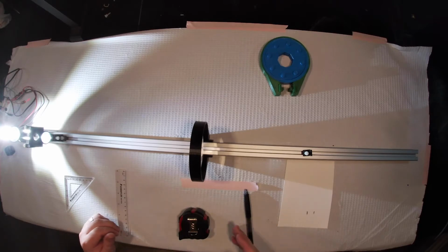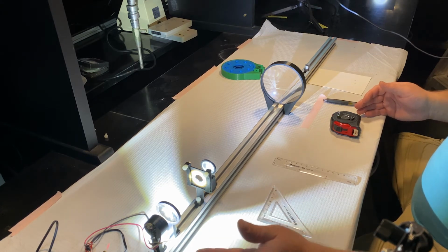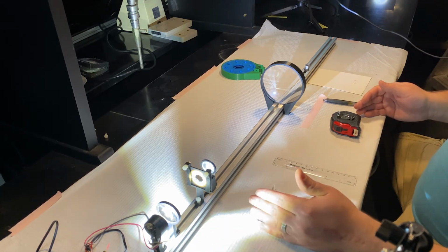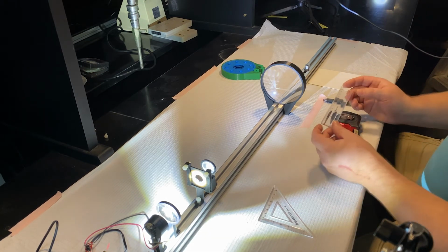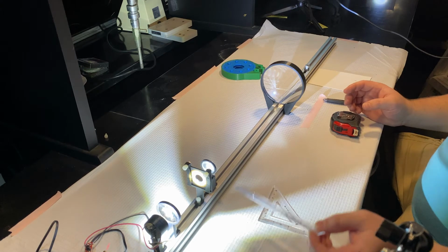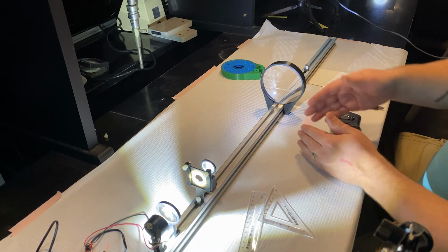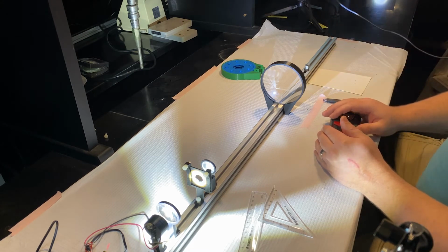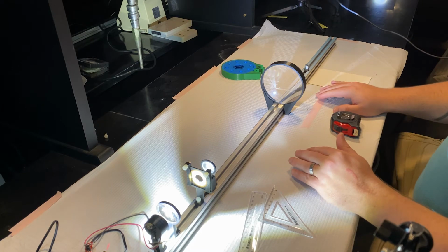Now, where we left off last time, we took a lens and we collimated a divergent light source so that our sample, our ever-trusty ruler here, would be evenly illuminated so that when we imaged it with a lens and formed an image of it somewhere down the line, it had a nice, evenly illuminated field of view.